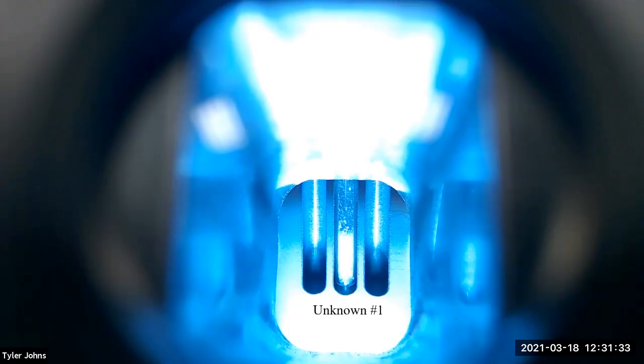We will now perform a melting point determination of unknown number one.